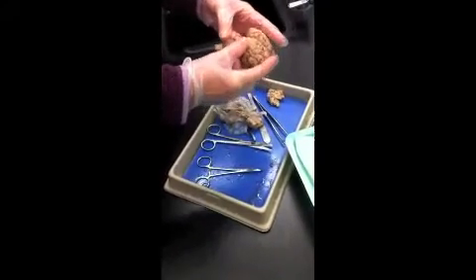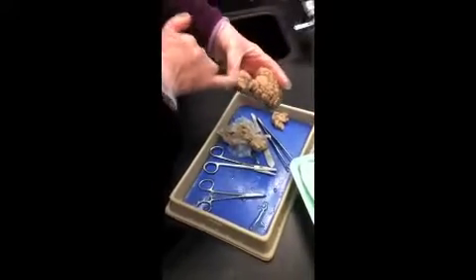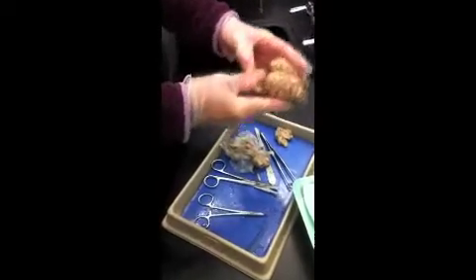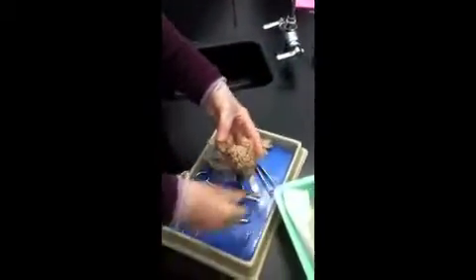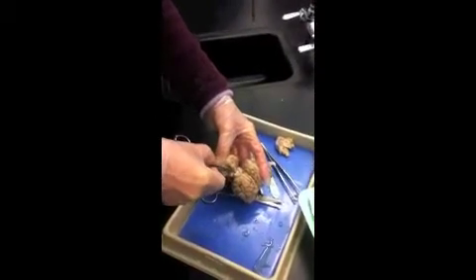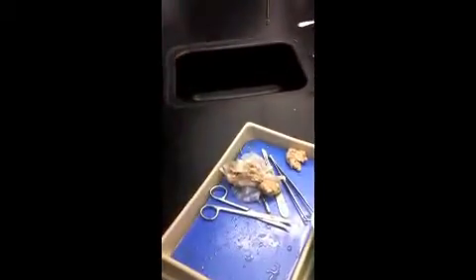Before I do that, I want to look now at this area between the cerebrum and cerebellum. I'm looking at what you could call the top, their dorsal surface; for us, it would be the posterior surface. What do we see here? We see 1, 2, 3, 4 bumps. Do you all see those?